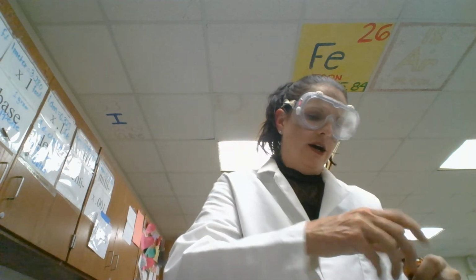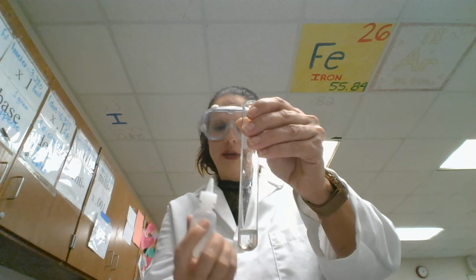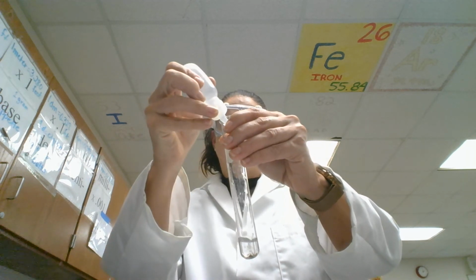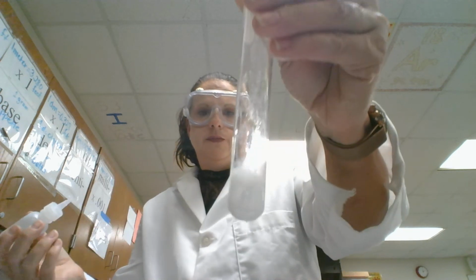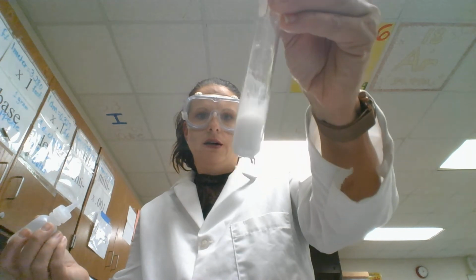All right, so we have our alkaline earth compounds, and we're going to add sodium carbonate to see if something happens, which is Na2CO3. So this is our magnesium nitrate, and we're mixing it with sodium carbonate. As you can see, it gets very cloudy. So another precipitate has formed. So a reaction, chemical reaction.